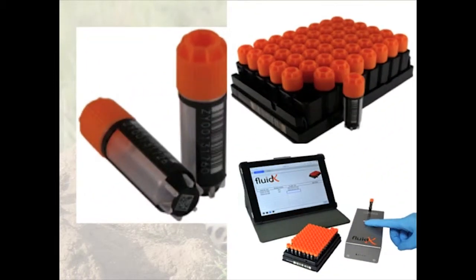With regard to this last statement, we will now briefly introduce you to the FluidX system that you will be using throughout this project. What you see here are 2D bar-coded cryovials, which will be used for both long-term storage of tissue and long-term storage of DNA, along with 2D bar-coded racks, which will hold the 2D vials, and a barcode scanner, which will read the 2D barcodes on the cryovials. The barcodes on the cryovials and plates will serve as unique identifiers of the tissue, DNA, and set of samples contained in the plate. We will be discussing this equipment later in Module 2.